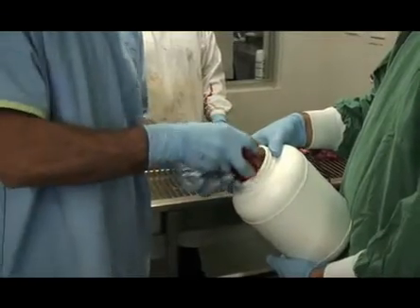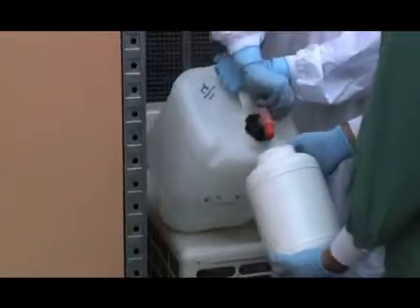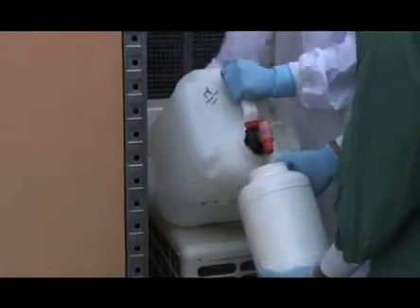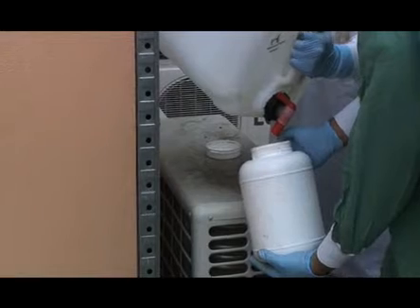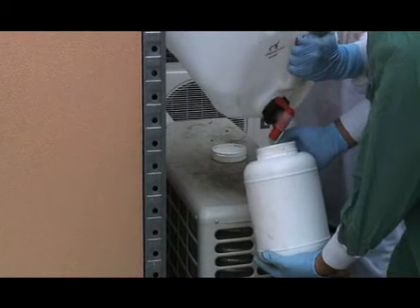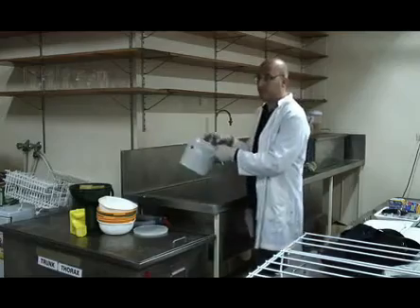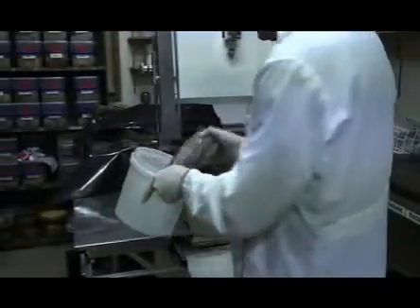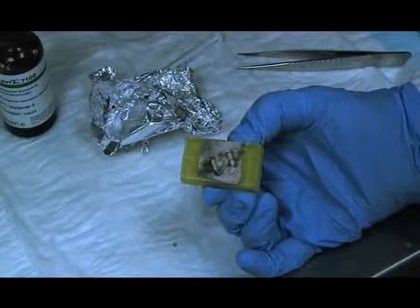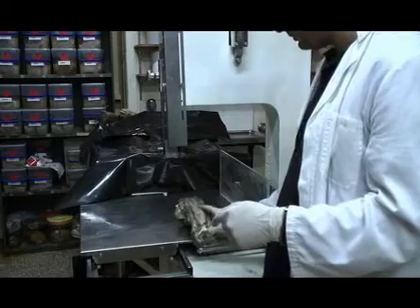Following tissue collection, the specimen — in this case the sheep's cervical spine — is placed in a sealed opaque container containing 10% phosphate buffered formalin solution. There should be minimal exposure to light if fluorochrome analysis is to be performed, as the fluorochromes are light sensitive. The specimen is then taken to the lab and trimmed to size, which improves fixation and ensures that it fits into a block. The orientation of the tissue on the slide needs to be known at this point so that the block can be prepared in the correct plane.